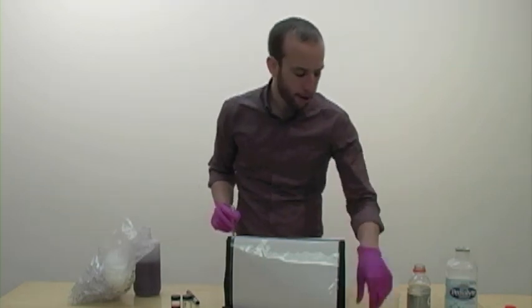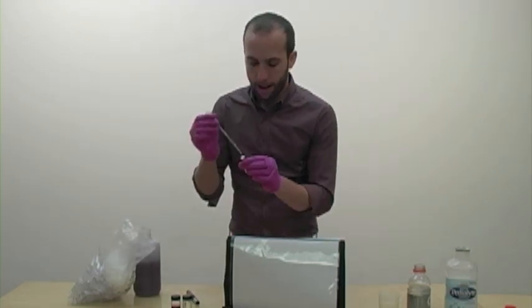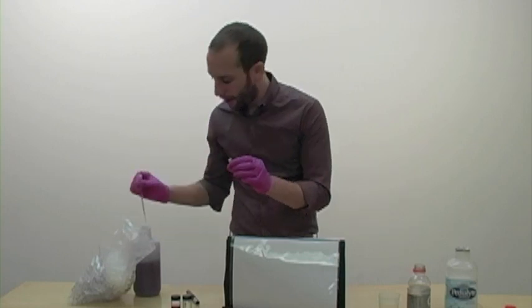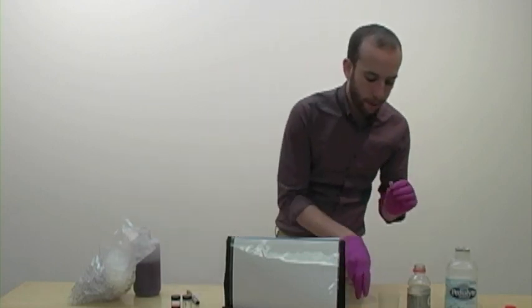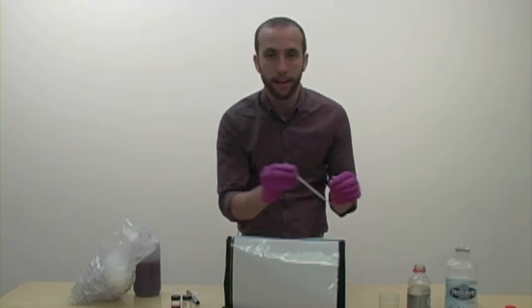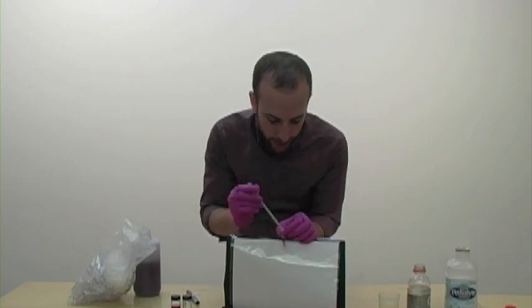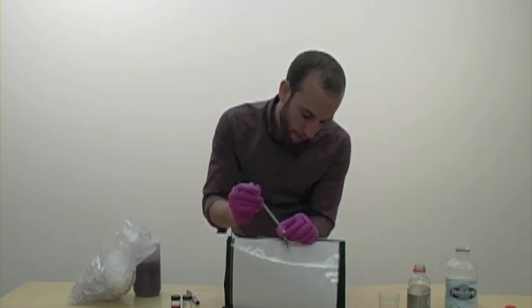Finally, let's see about the pickle juice, shall we? So again, halfway. You may notice that I'm using a different pipette for each of these solutions. Why do you think that is? That's right, because I don't want to contaminate my fluids. That's a good scientist fact.